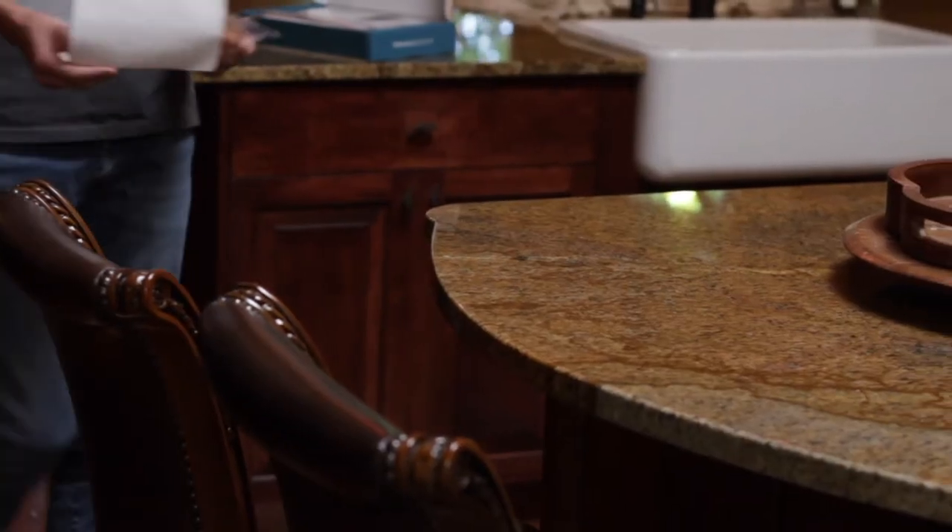Here are some specific instructions for different room types. For kitchens, a countertop toward the center of the room is ideal. Also, ensure that the mold testing plate is at least two feet away from the wall.